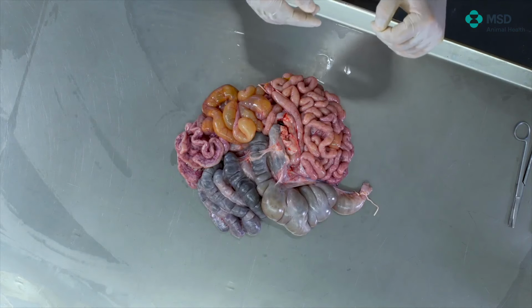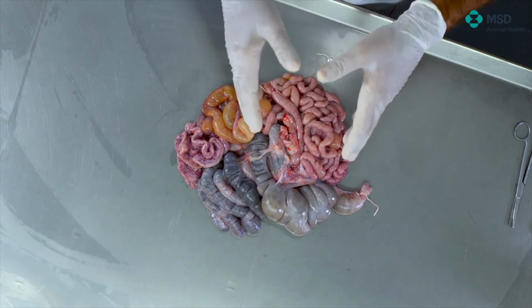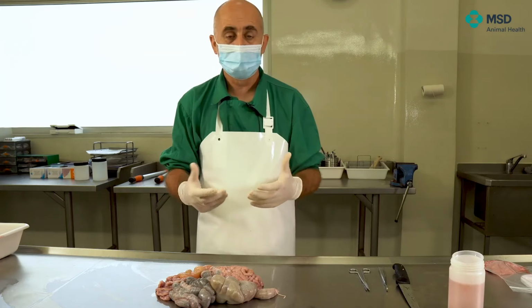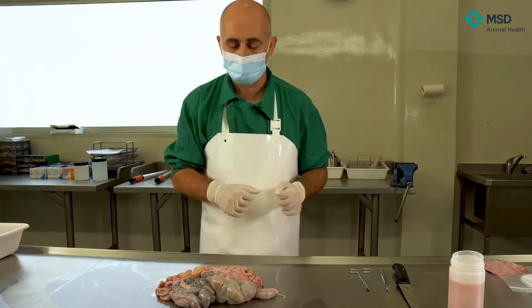So from this point of view, it's very, very imperative to know which are the different areas of the intestine, because when we have them together, especially within the carcass, sometimes it's difficult to know if this is jejunum or duodenum or ileum. So it's really, really important to assess which part we need for each case, because not all diseases need the same type of sample in order to analyze potential pathogens. In this form, of course, it's all the package together. However, we can rapidly assign different situations.